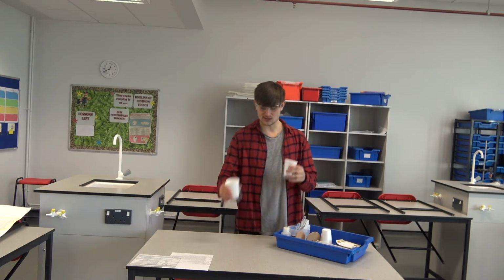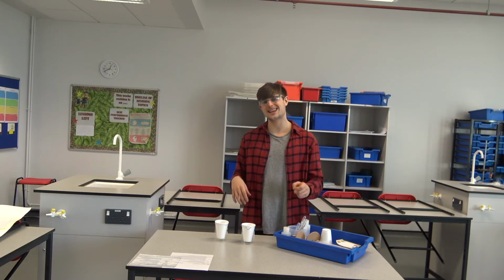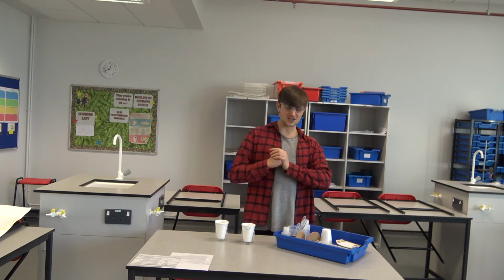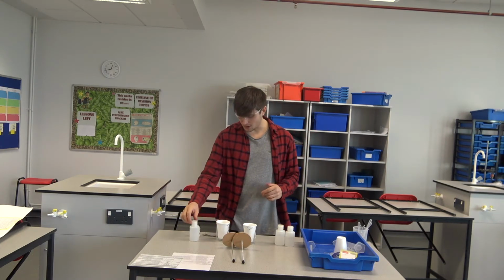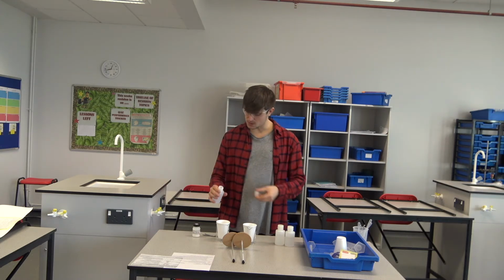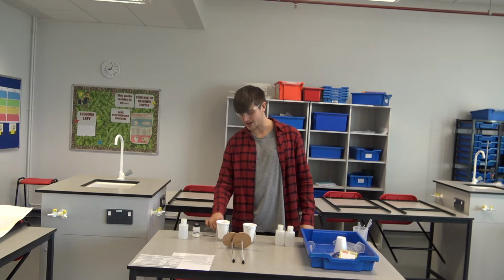So what I have here is two polystyrene cups inside a glass beaker, and I have some chemicals which I'm going to react together, and we're going to see the progress of that reaction and see whether the temperature has gone up, and if it has, then we have an exothermic reaction, and if the temperature goes down, we have an endothermic reaction. The first reaction that I'm going to look at is ammonium chloride and distilled water. I'm not actually going to measure out the distilled water, but if you were doing a controlled experiment, you would use a measuring cylinder to measure that out.